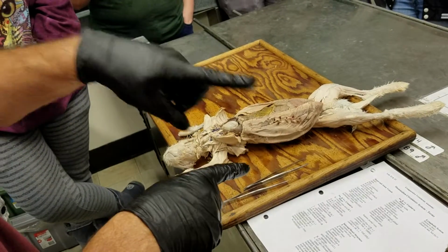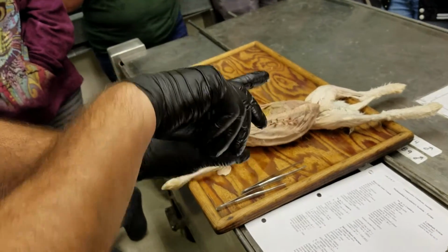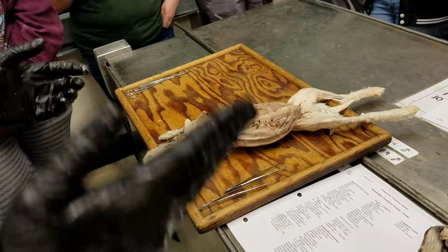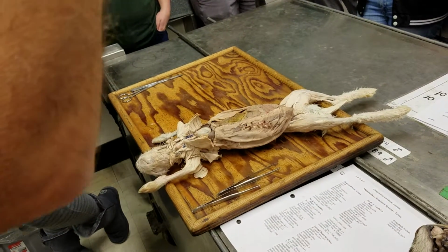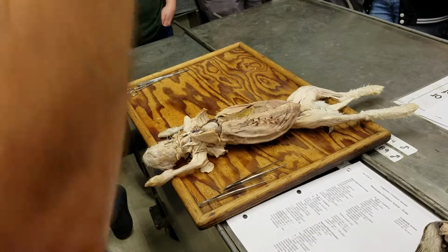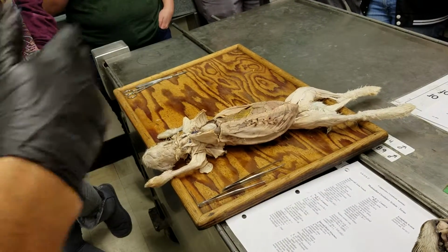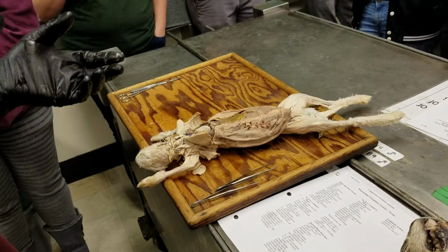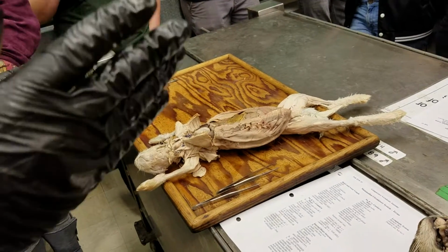You can remember the pulmonary trunk's doing this, the aorta is doing this, and they kind of are twisted around each other. And if you remember back to the frog heart I was talking about yesterday in lecture, where there's that spiral valve in the conus arteriosus, that spiral valve basically forms a complete partition in these guys that separates the pulmonary and systemic circulation. And that's why there's this kind of twisting around of the aorta and the pulmonary trunk, is that division because of that spiral valve.